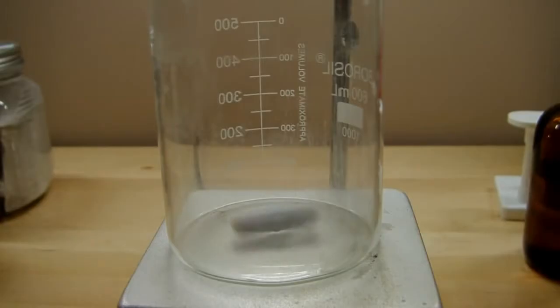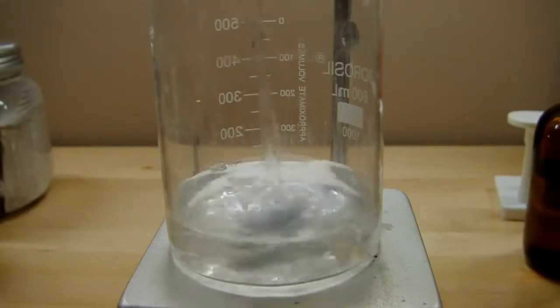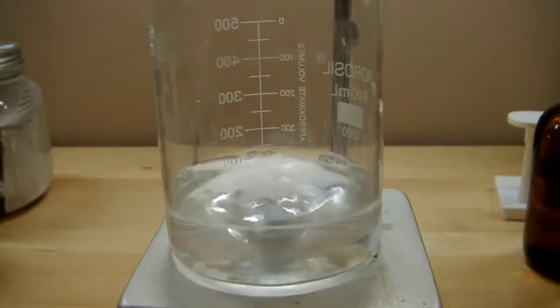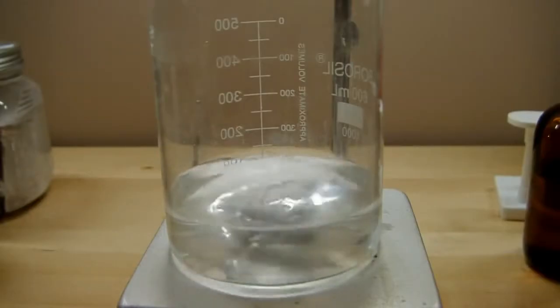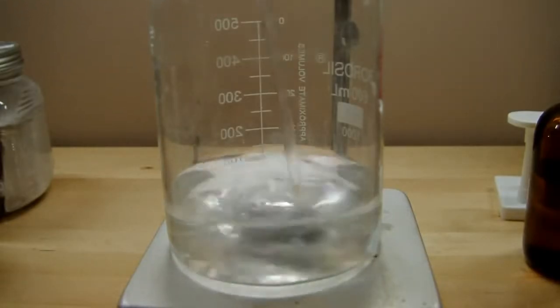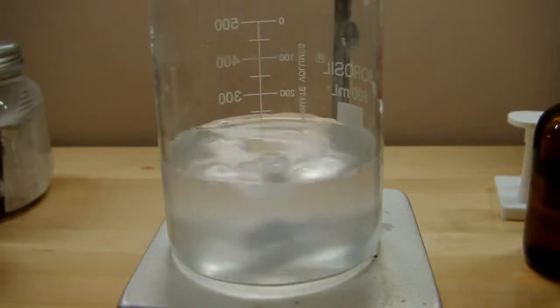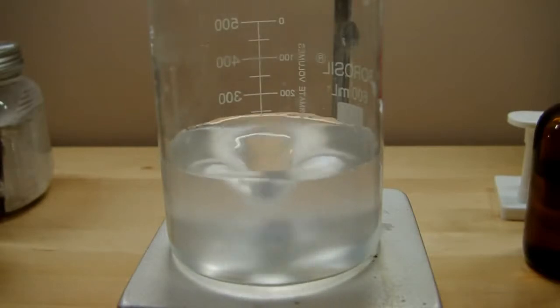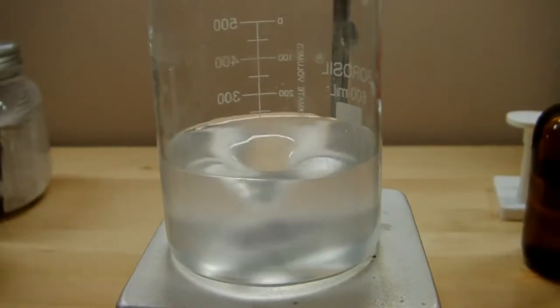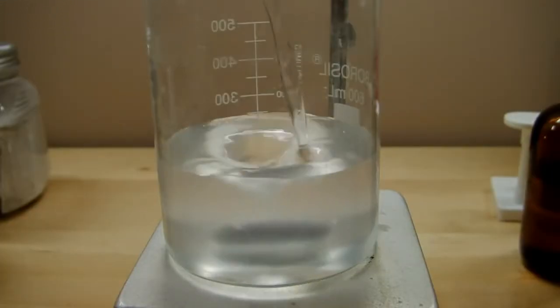Okay, now on the stir plate I'm going to combine all 3 solutions together. So first is solution A. To that we'll add solution B, and it doesn't matter in which order this is all done as long as they're all added together quickly, or relatively quickly. And so nothing happens when both of them are together, so we need to add solution C to get the reaction going. And once that's done, you'll see that the reaction starts immediately.